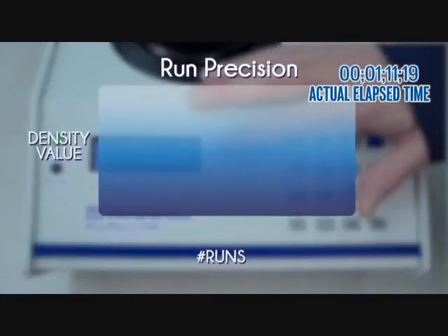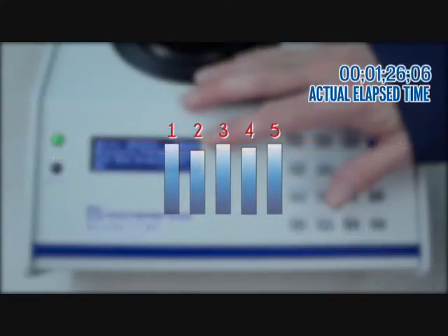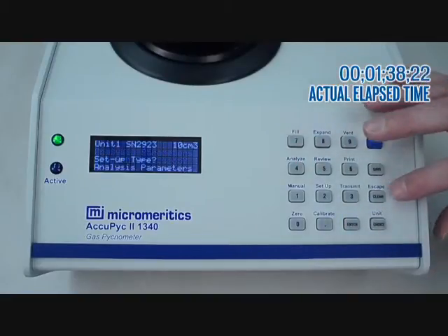This is another key feature of the instrument. If we were performing 5 analyses or more, the run precision option allows the instrument to automatically look for 5 consecutive analyses that meet a tolerance set by you within the unit. Once the results meet this threshold, the analysis is completed and the statistics of the last 5 analyses are calculated. Since we only set the unit for 1 analysis, this is not an option. With the choice and enter buttons, we can choose report options.